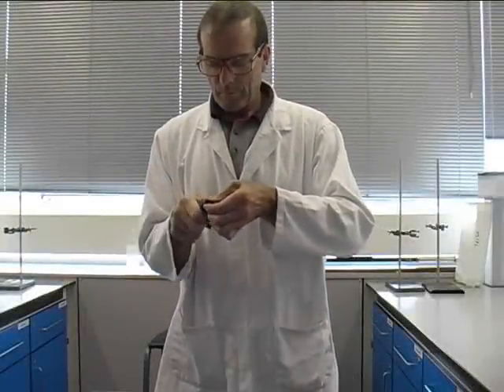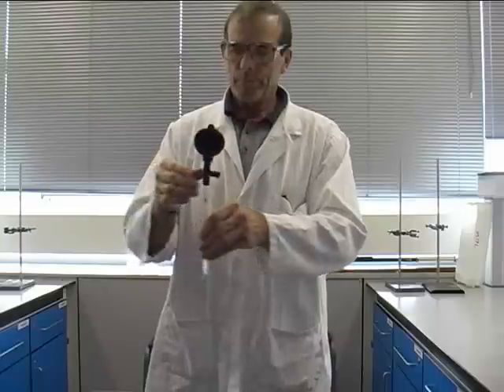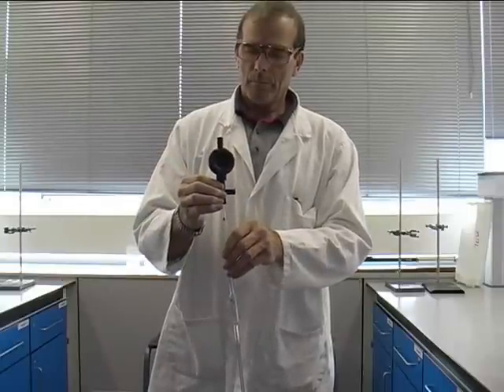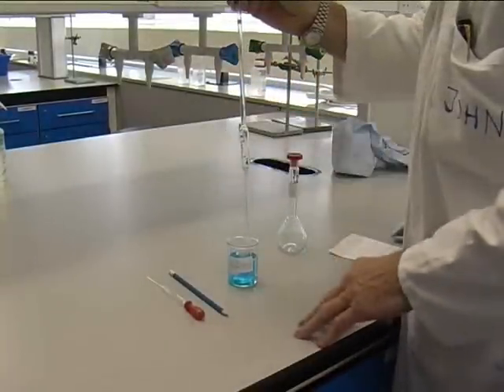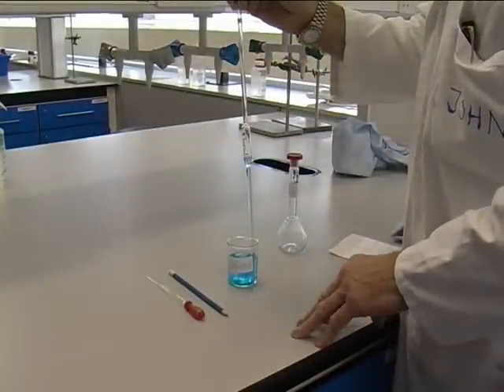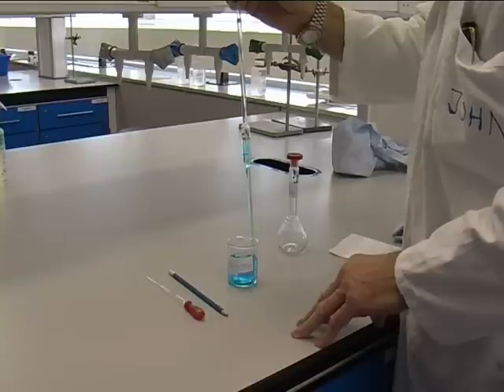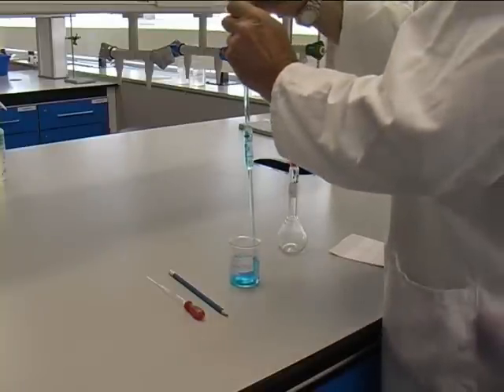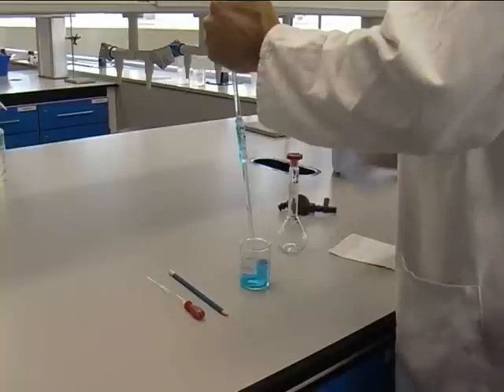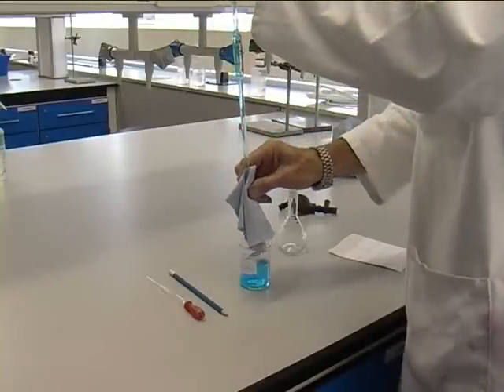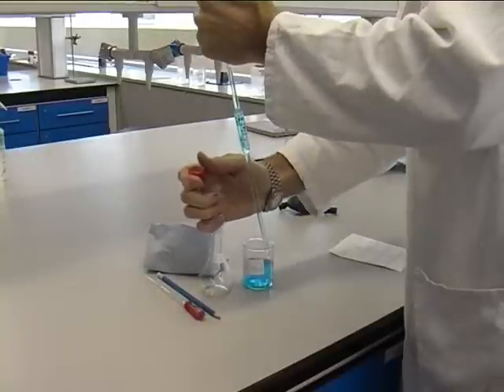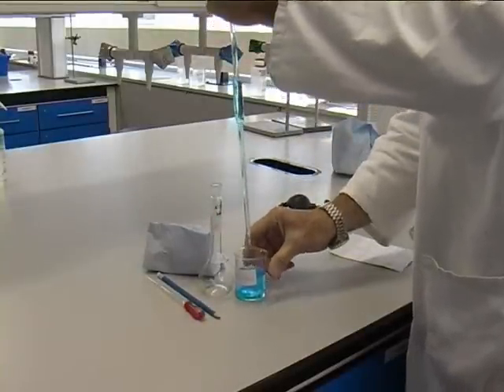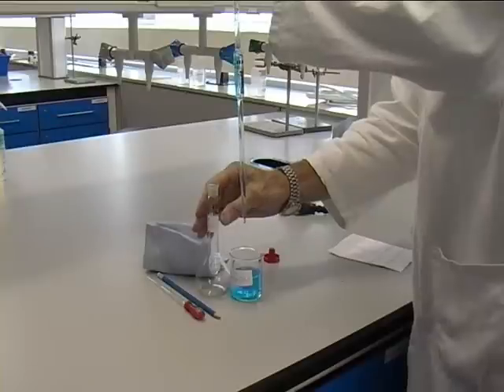And here we see how to fill and empty the pipette. In order to perform a sequential dilution, fill a pipette of the desired amount 3 cm above the graduation line. Quickly remove the safety bulb and put your thumb over the top of the pipette. Wipe the surplus liquid off the pipette. Gradually allow the pipette to empty down to the graduation line.